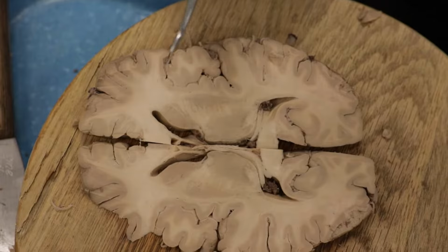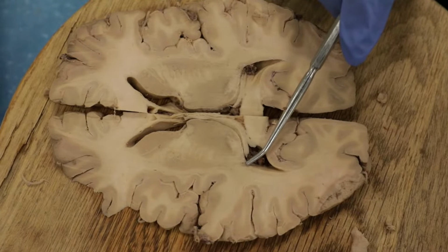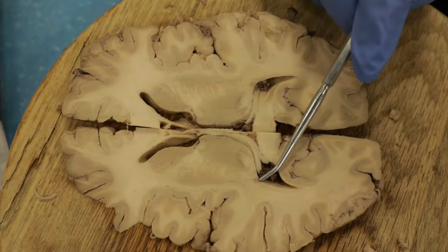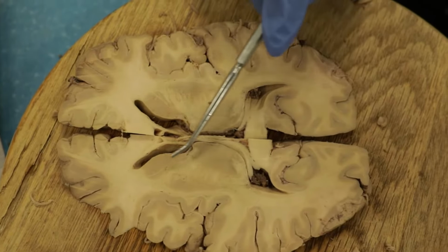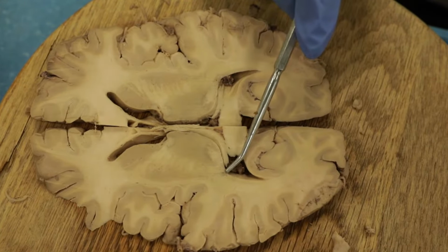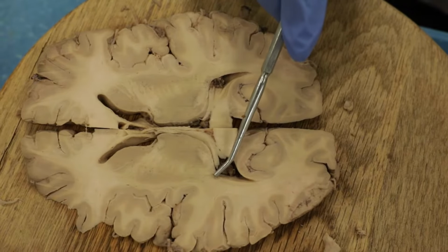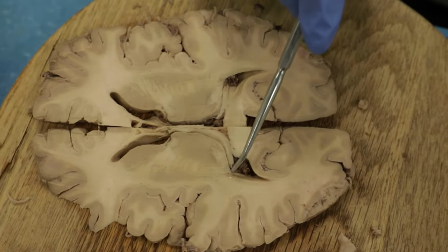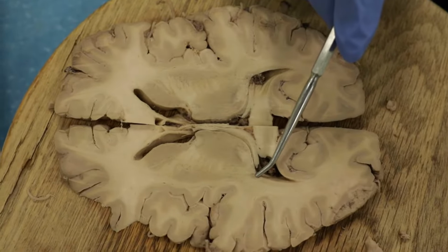Okay, last thing I'll point out here is we can see there's some gray matter right there, some neurons. Okay, this is the tail of the caudate. This is what makes neuroscience difficult initially. We have all these C-shaped structures. So the caudate is a C-shaped structure. Here's the head and body of the caudate. Here's the tail of the caudate. Okay, if you do a horizontal section through a C, you're going to see it in two different locations, here and here. So the tail of the caudate, we will see here as we cut deeper down into the lateral ventricle, and especially as we get down into the temporal horn of the lateral ventricle, we'll see the tail of the caudate there.